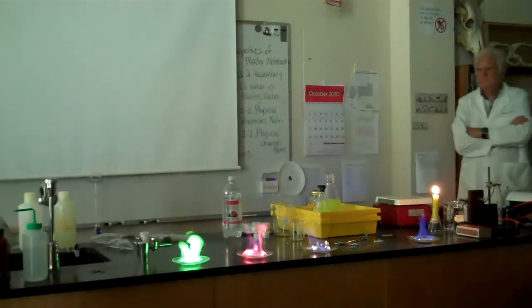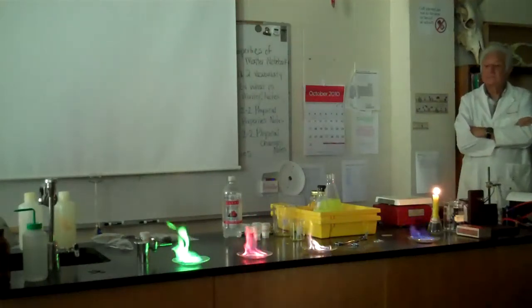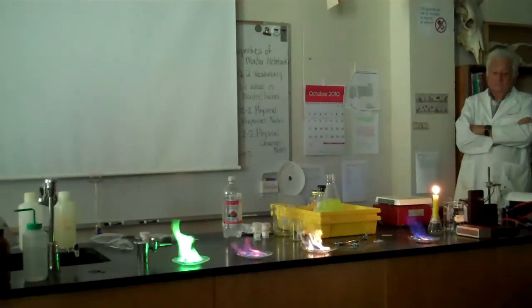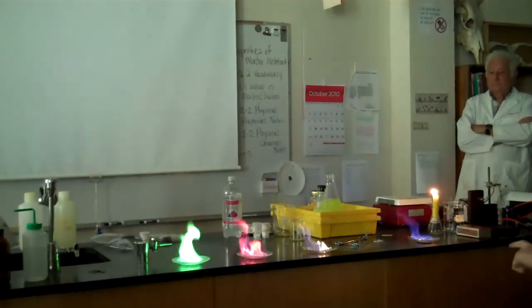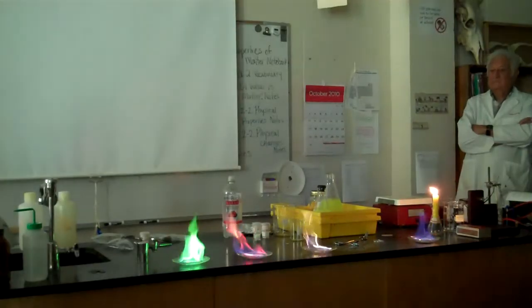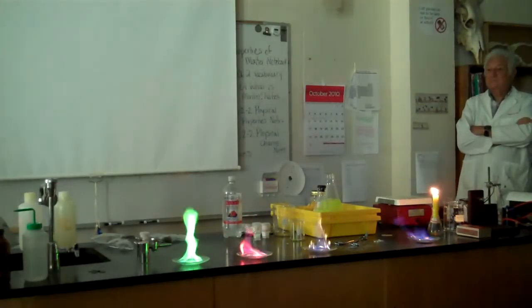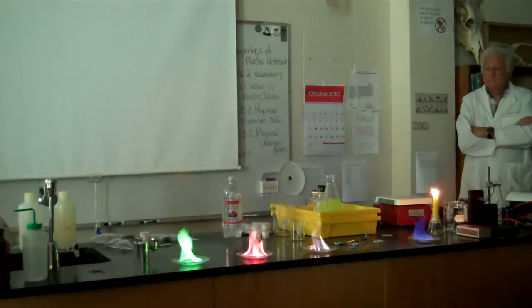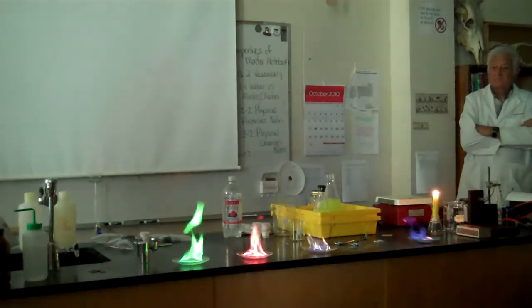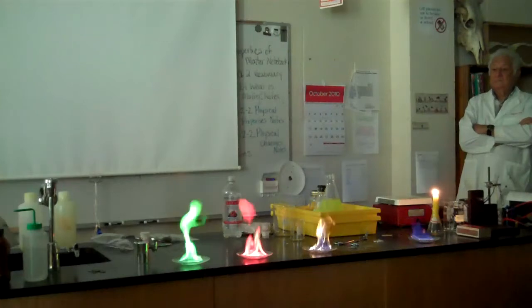This is kind of like what you see with fireworks — it's the same principle. What's burning right now is the alcohol, but it's hot enough to where it ignites the metal to a certain extent. And that's why you get these different colors.